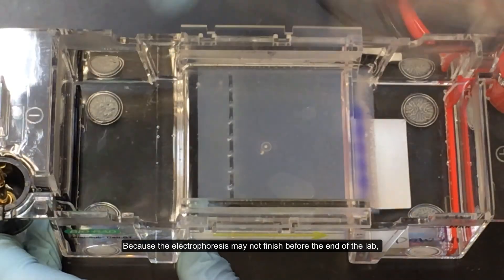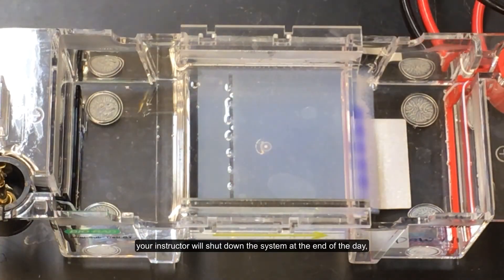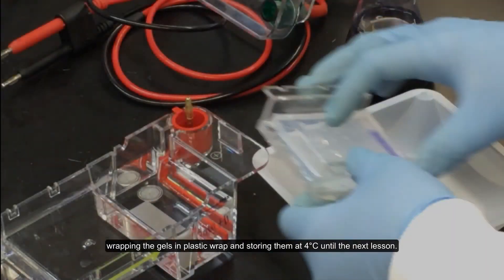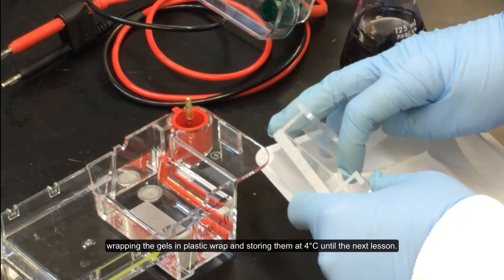Because the electrophoresis may not finish before the end of the lab, your instructor will shut down the system at the end of the day, wrapping the gels in plastic wrap and storing them at four degrees Celsius until the next lesson.